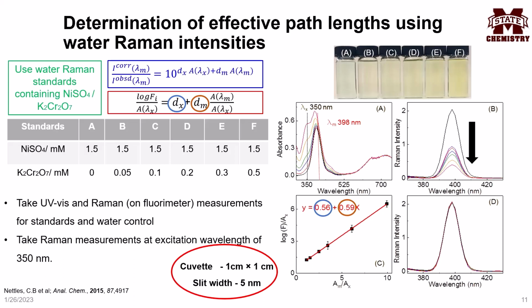When the Raman excitation and emission are in the region where the chromophore shows maximum absorption, the water Raman signal intensity of the chromophore mixture decreases with increasing chromophore concentration. This is due to the inner filter effect. As can be seen, the effective excitation and emission path lengths were determined successfully through linear curve fitting of the water Raman data collected in B.